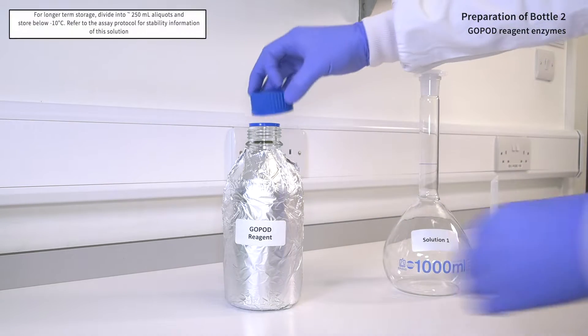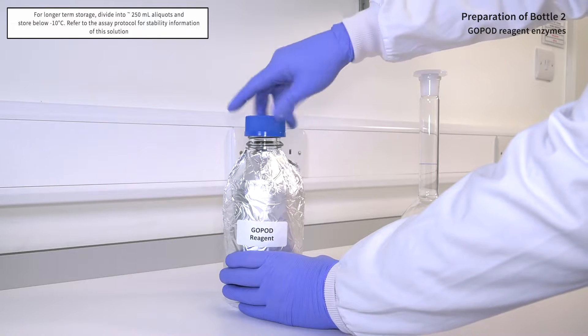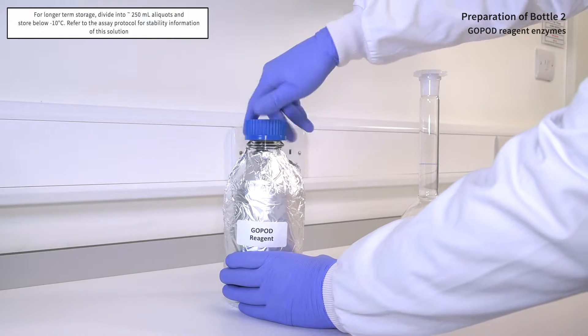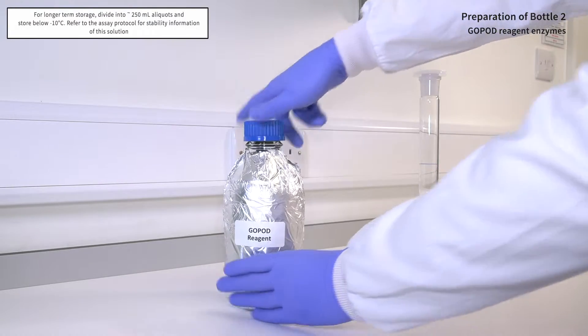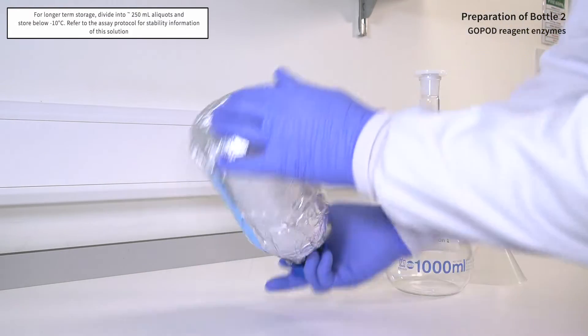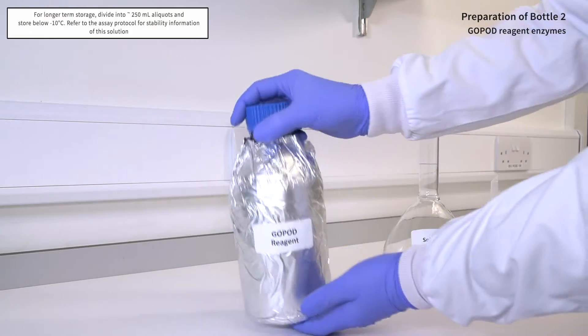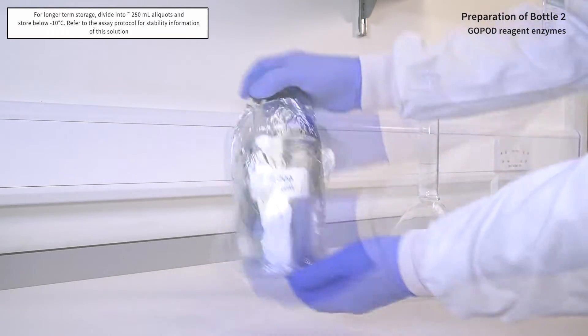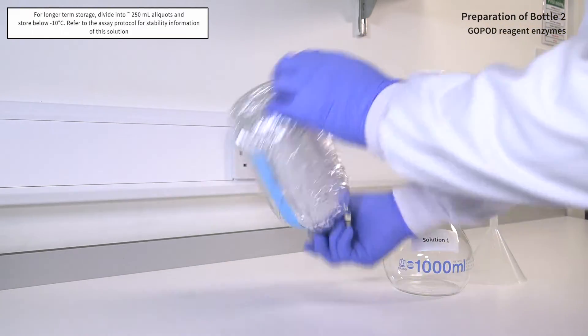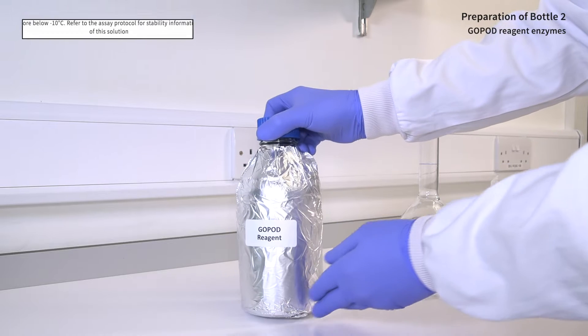Transfer to a 1 litre Duran bottle covered with aluminium foil to protect from light and mix thoroughly. For longer term storage, divide into approximately 250 ml aliquots and store below minus 10 degrees Celsius. Refer to the assay protocol for stability information of this solution.